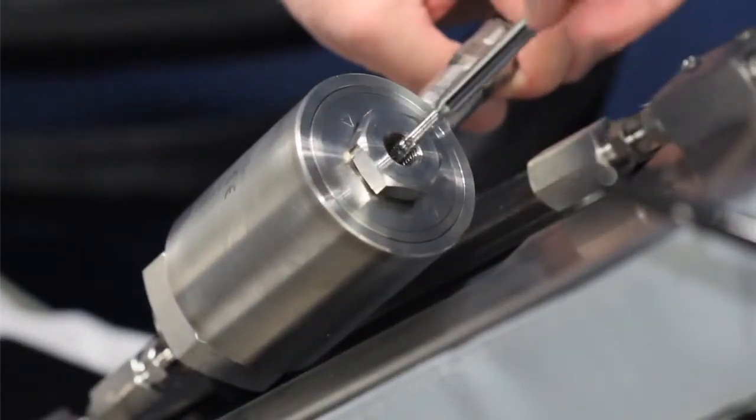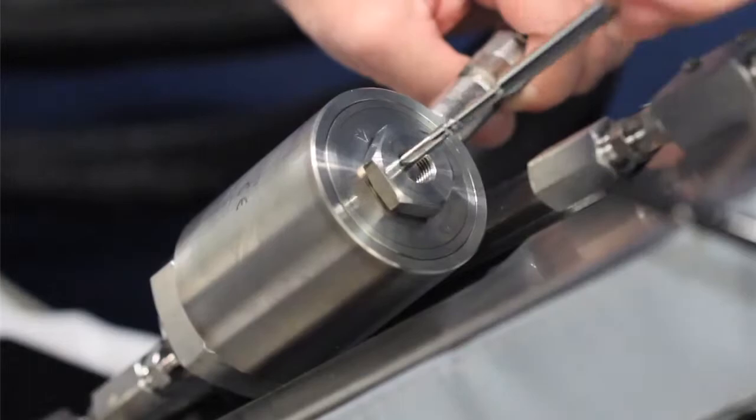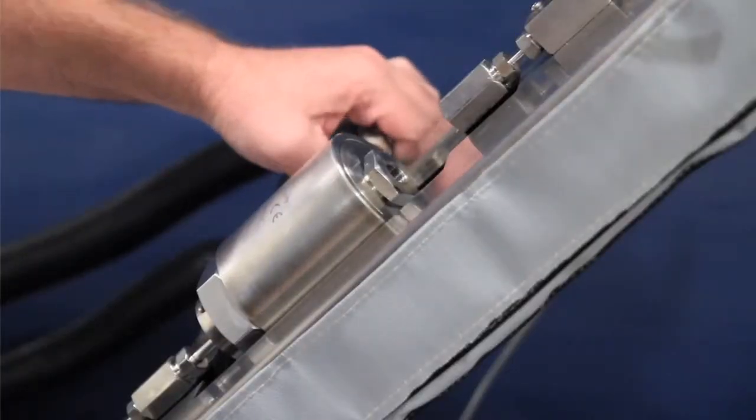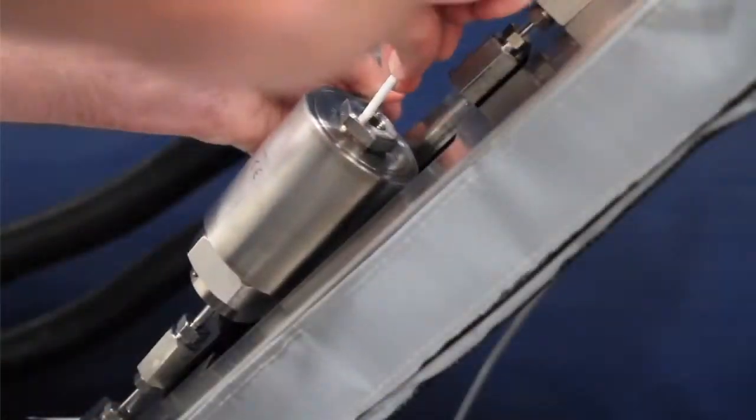Insert dry piston back into the clean sensor with the flat side of the piston facing up. You have now completed the process of cleaning the sensor.